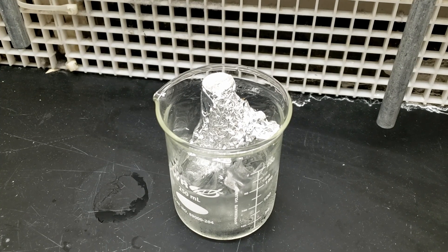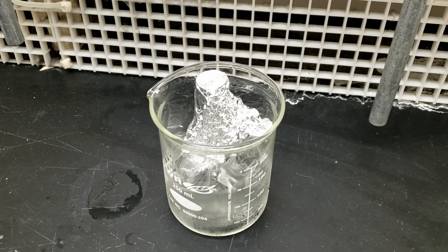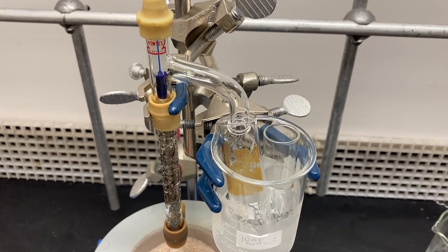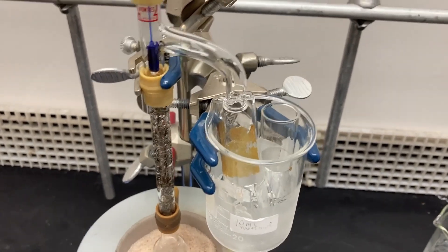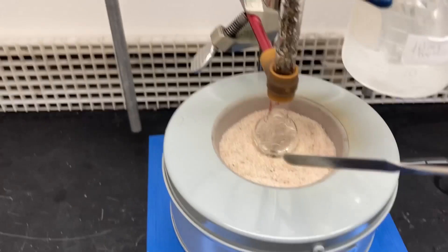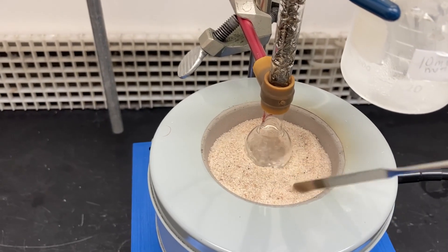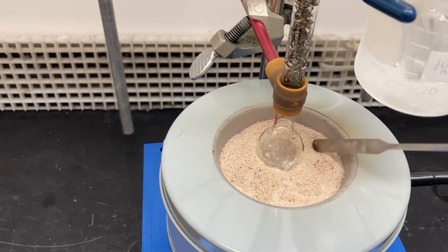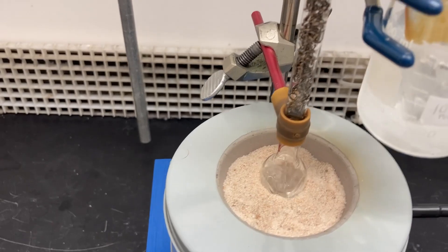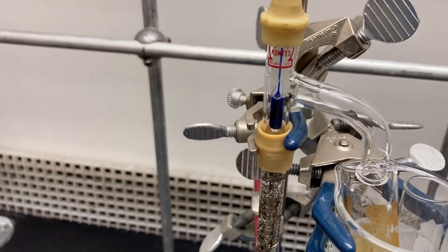Cover your fraction one and place on ice to prevent evaporation. Continue recording temperatures and drops. Be sure to continue the same table you used in fraction one so there is no break in the data. We will then plot the drops versus temperature data using Excel after we have completed the data collection. Be sure to have your x-axis labeled as drops and your y-axis as the temperature.